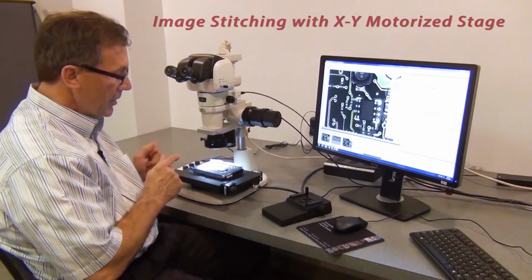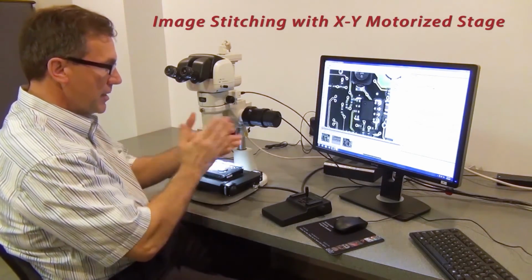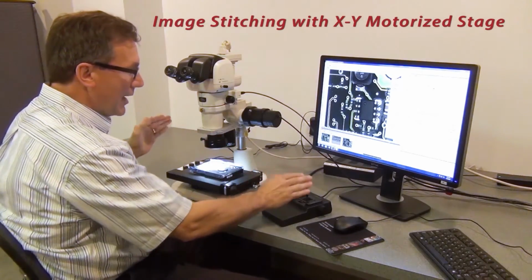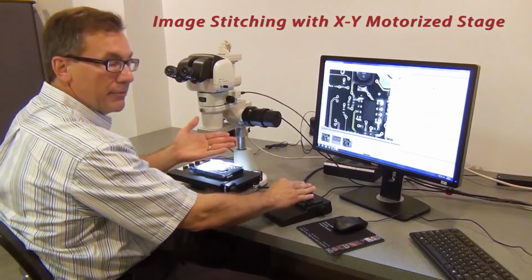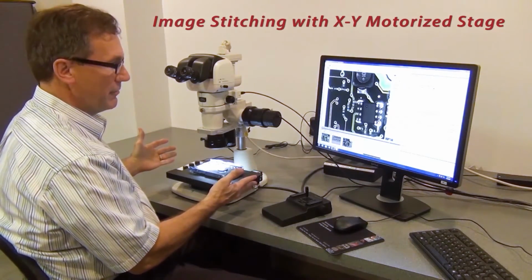So now let's talk about the XY motorized stage. Here we have a situation where I have my sample. I'm at the lowest magnification of my microscope, but I want to see a little bit more than what I can fit into one field of view. There comes the XY motorized stage benefits.